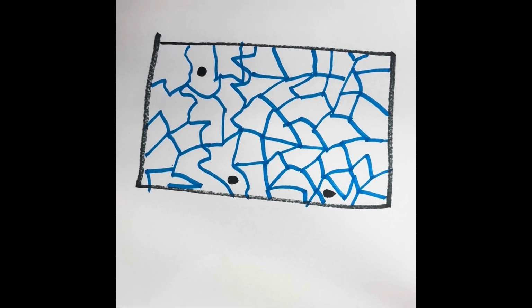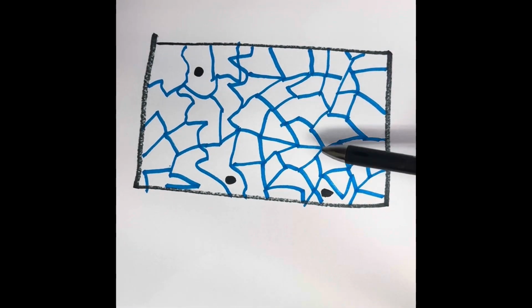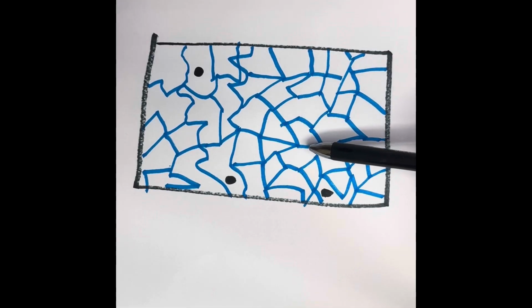Another fibrous connective tissue is the reticular. If you notice these loosely arranged fibers right here, it actually kind of looks like a lightning storm going on in here. But these loose fibers are strung together to create this spongy-like material, and they actually filter the lymphatic system.